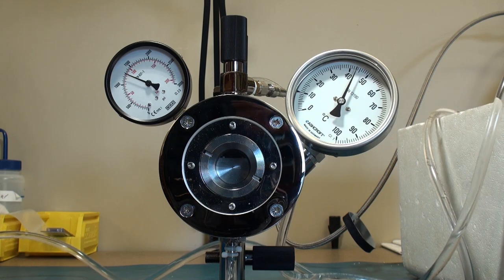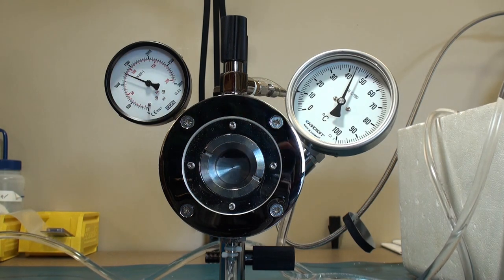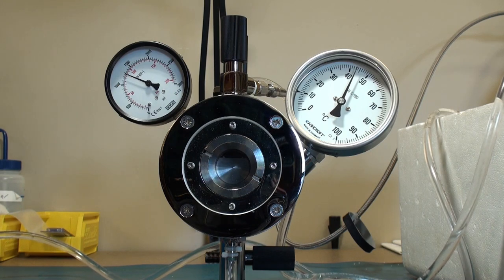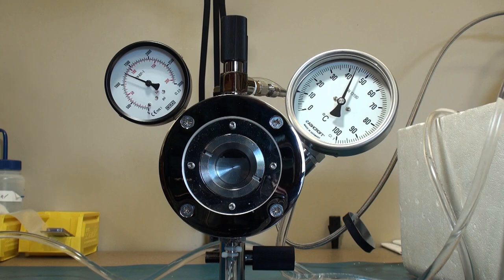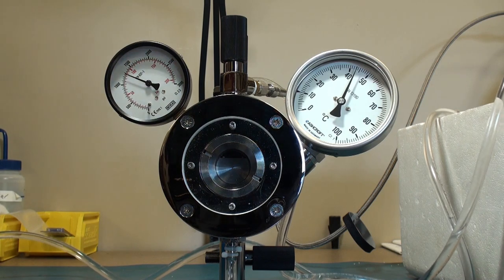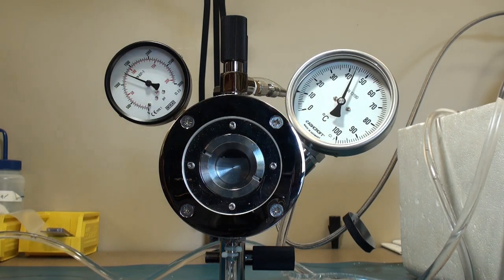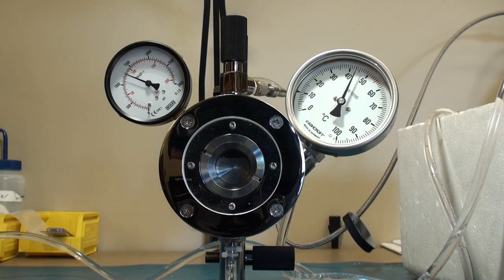Some sort of cooling circuit or a heating chilling recirculator, some sort of closed loop feedback system that would not allow it to exceed the maximum pressure of the burst membrane, which is 1850 PSI high.